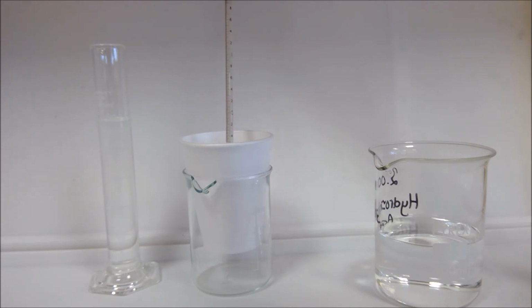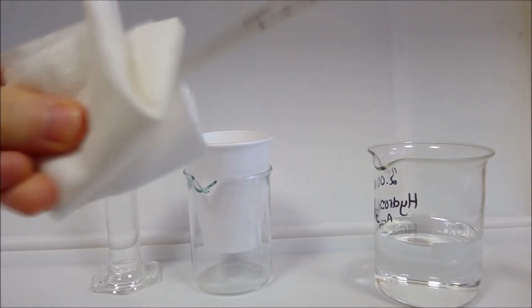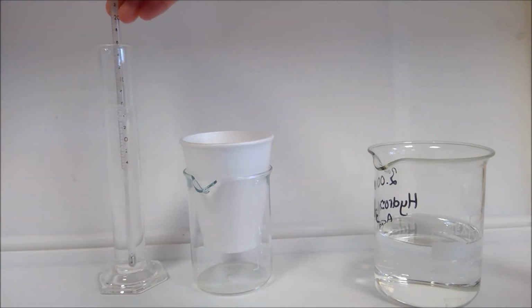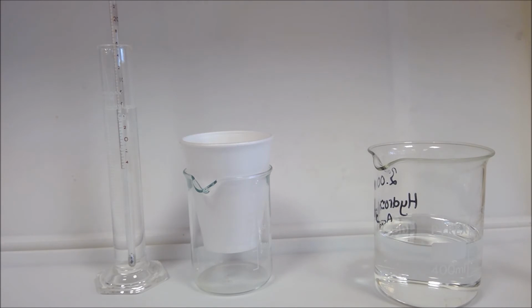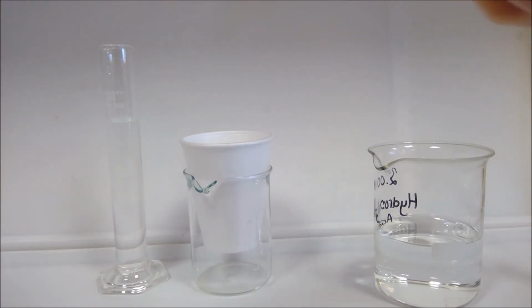So this is reading 17.40 degrees there. So I'm going to dry that so I don't cause any reaction in transferring into my sodium hydroxide. These have both been sitting in the lab for a few days, so they ought to be at the same temperature, but we'll just double check. Yeah, so 17.4 on that one as well. Okay, so we take that out.